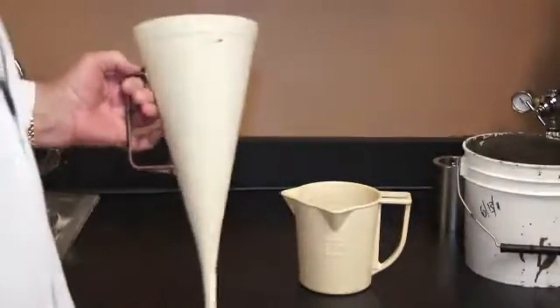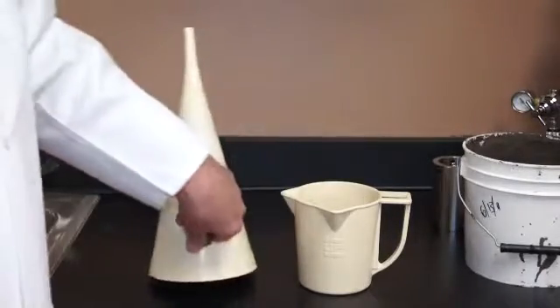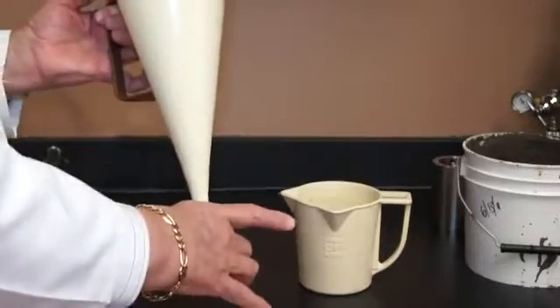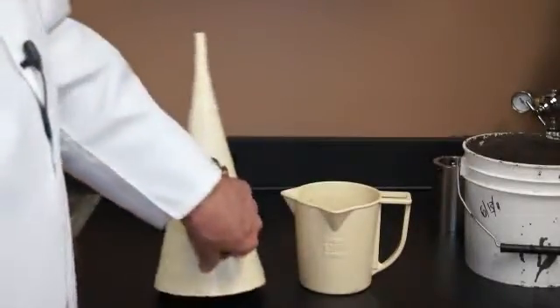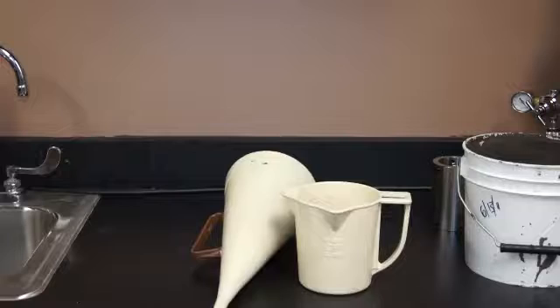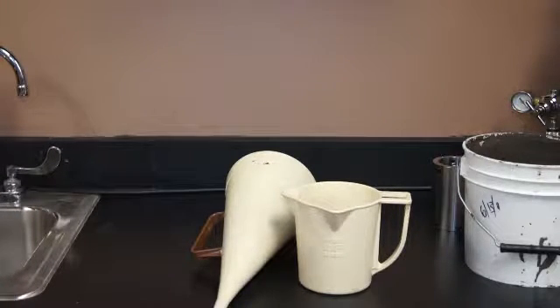There is no real correlation with this type of viscosity with rheology as measured with a viscometer or a rheometer. The main reason is that this is gravity fed, so if you have a denser fluid, it's going to flow out faster than a less dense fluid. That gets us in the realm of what's called kinematic viscosity, which is measured in centistokes. Typically, kinematic viscosity is the centipoise reading divided by specific gravity. So you get into density considerations there, which you don't consider so much when you're using a regular rheometer, Couette style, with a rotating rotor and a bob attached to a bob shaft.